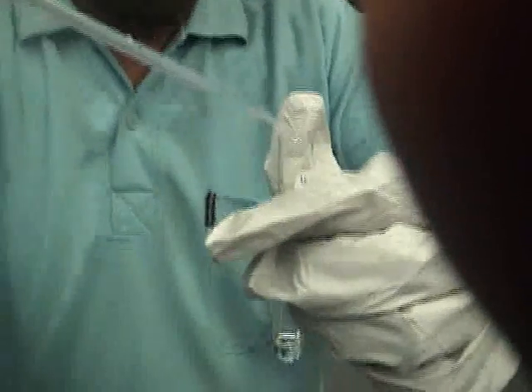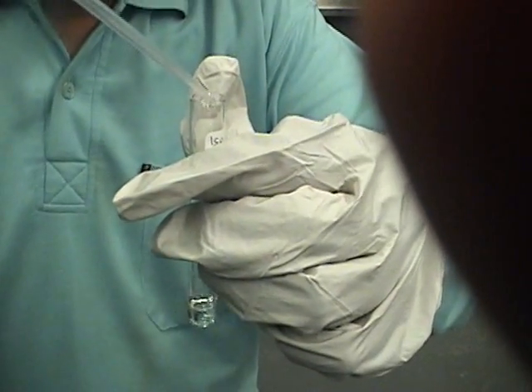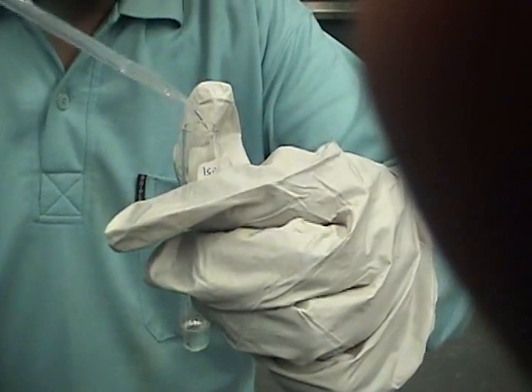With agitation to mix well, add approximately 2 ml of sodium hydroxide solution to neutralize the sulfuric acid and acetic acid formed in the reaction. You must add enough to smell the esters, otherwise the acetic anhydride will mask the smell of the esters.